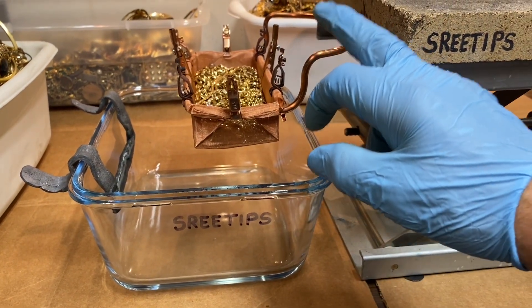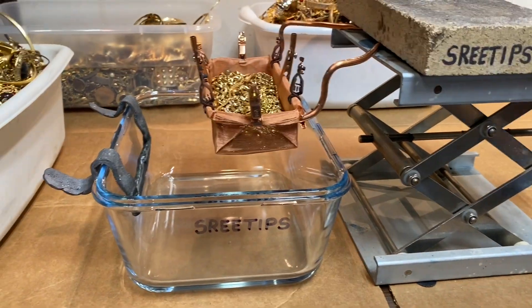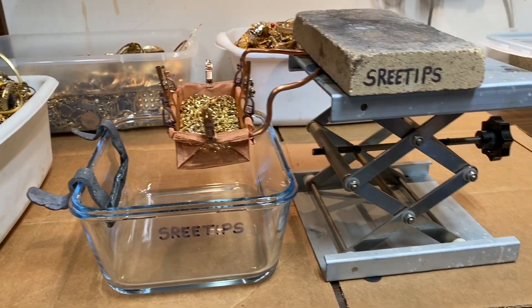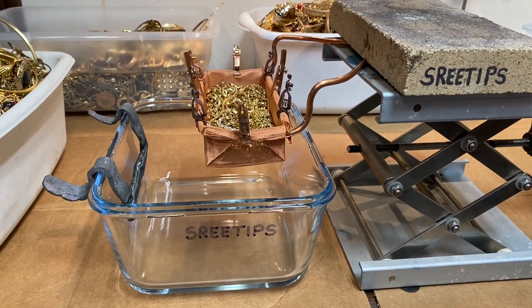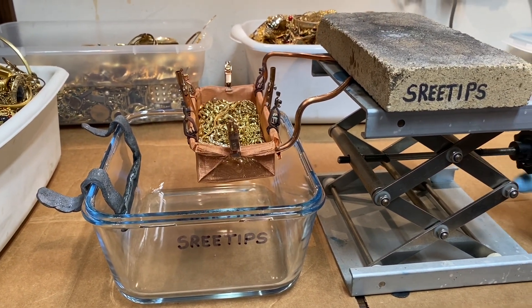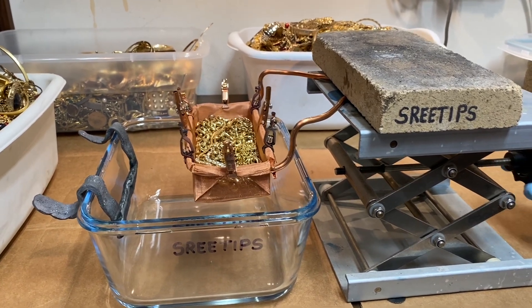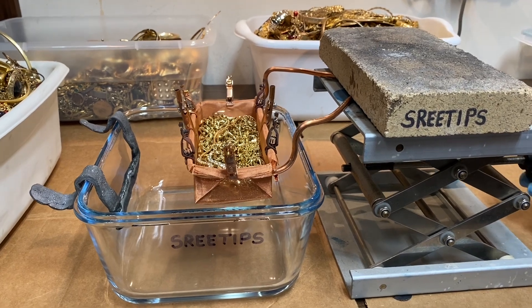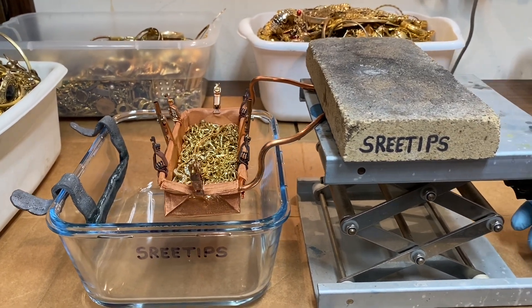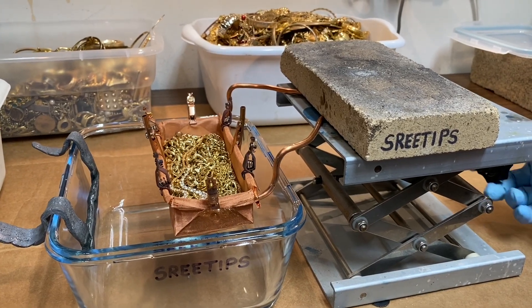I'll connect a positive lead on here and a negative lead on here off a battery charger. The sulfuric acid will be in here, and then we'll turn the power on and just slowly lower this into the electrolyte. We'll have to keep a watch on the battery charger — we don't want to overload it. But I think this is going to work pretty good.